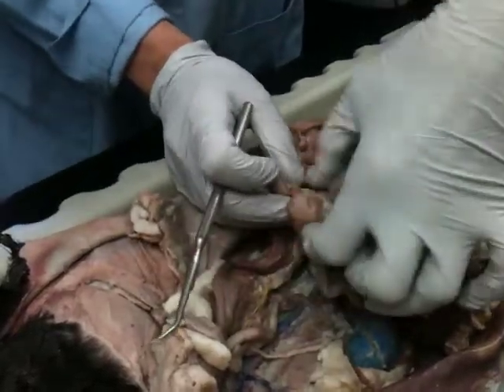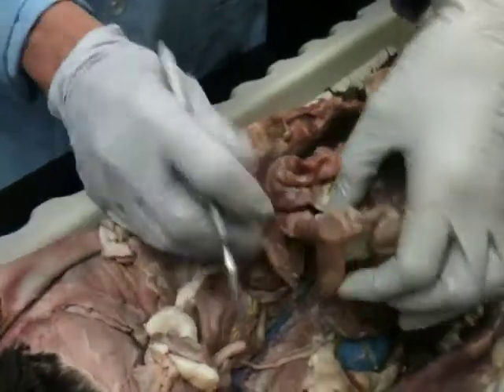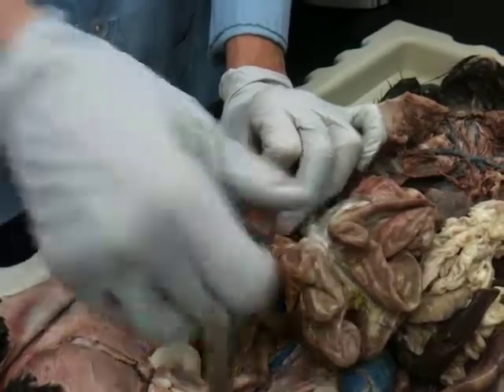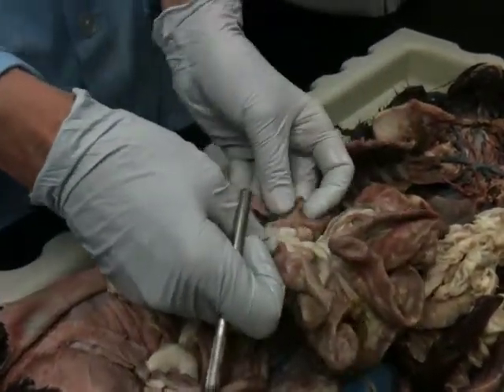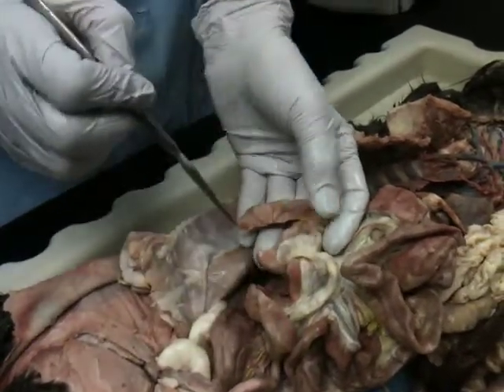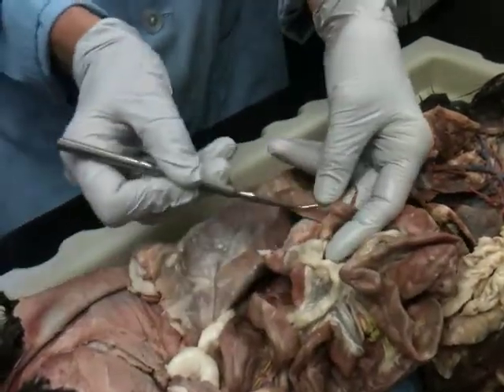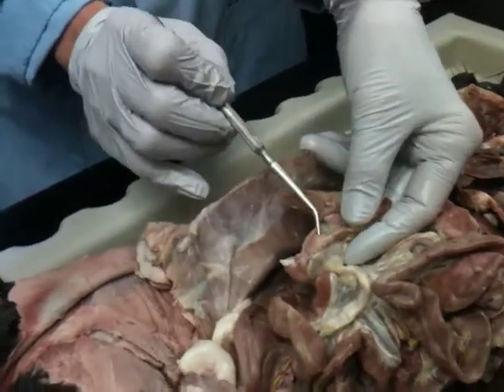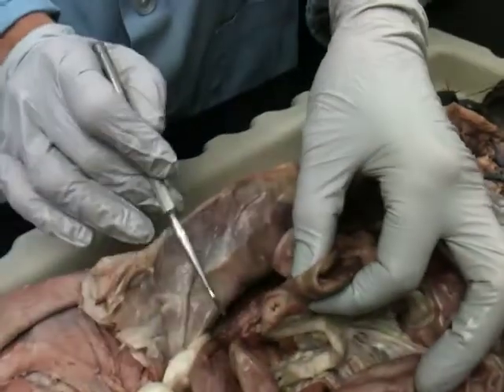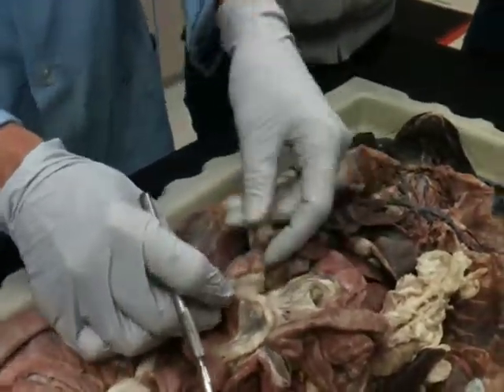I took a look at this area, which was kind of neat to see. So you see the different size. Here's the small intestine. It is smaller in size compared to the large intestine. And the area where the two meet, we have a part that comes down here. This is called the cecum of the large intestine. I cut open here, and we're going from the ileum to the cecum, so we have an ileocecal valve right there. It's kind of a neat little valve, if you want to see it there. Ileocecal valve. You don't need to be able to identify that, but it was kind of neat to see it.